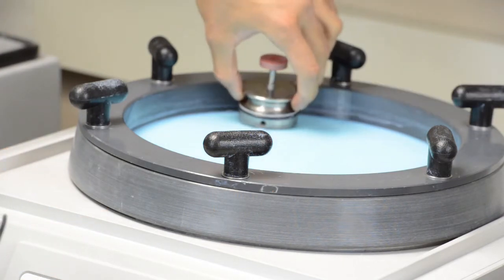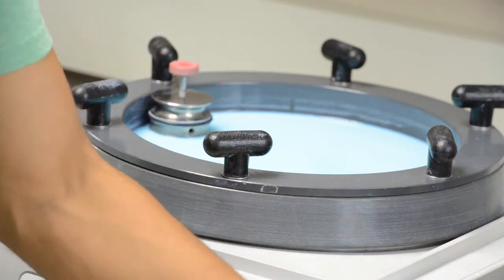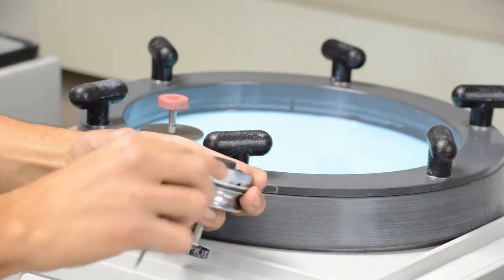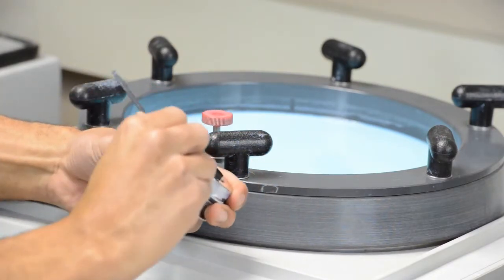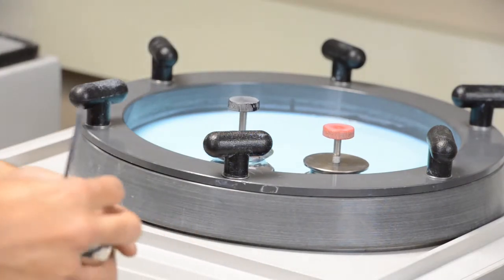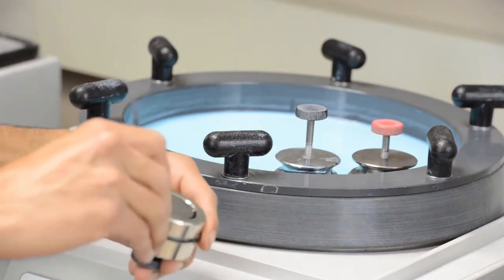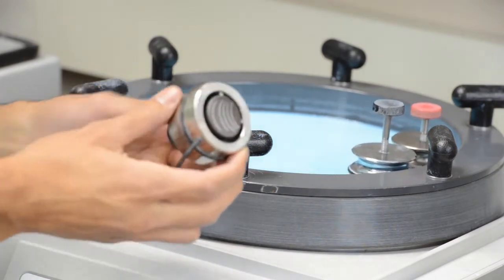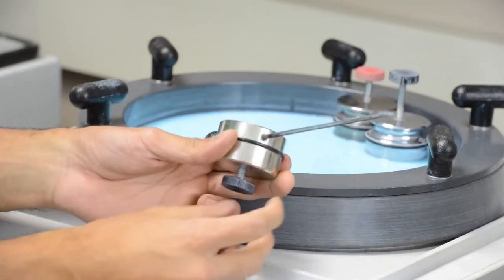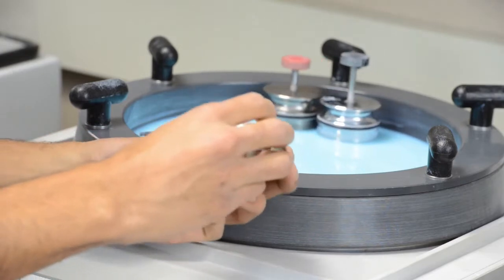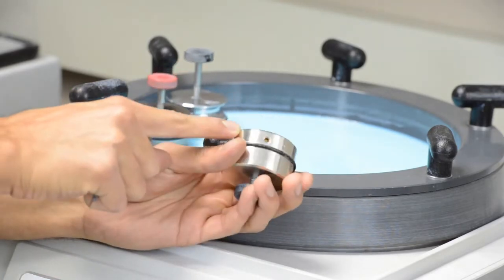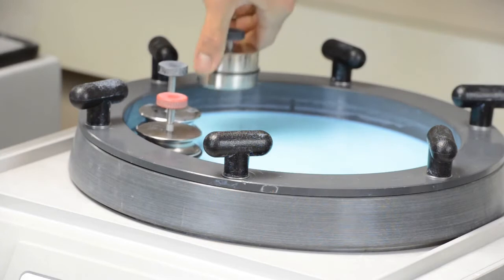So there you go. I think this is ready. Alright. So I'm just going to put it right there. And it starts rotating. Let's do the next one. Alright. When it's sticking out a little bit, tighten this one right here. Tighten this one as well. Put it right there. And on it goes. And there's a bigger set of these sample holders. I want it sticking out a little more than that. So I'll just push it with this. There you go. There you go. It goes sticking out. You see it? Hopefully you do. And if I put it, it's the only thing that's going to be touching the pad.